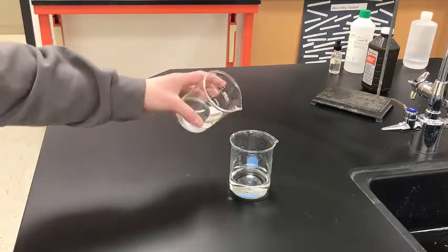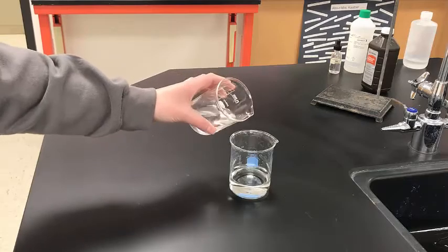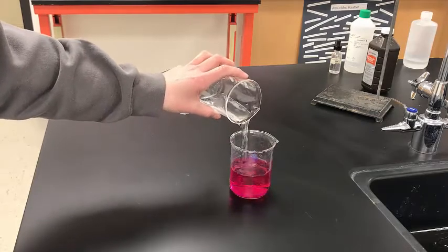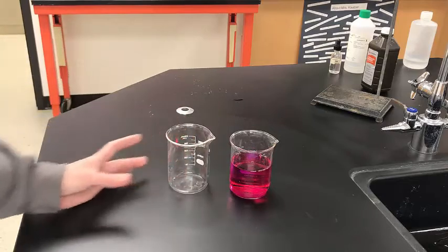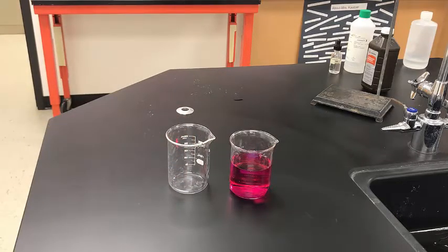Okay, so we have here, what do you think's happening? Oh. You've seen this before, because it's a good classic, one of my favorites. Okay, so you have here, there's your reaction. So what's your evidence that a chemical reaction has occurred? It should be pretty obvious to you.